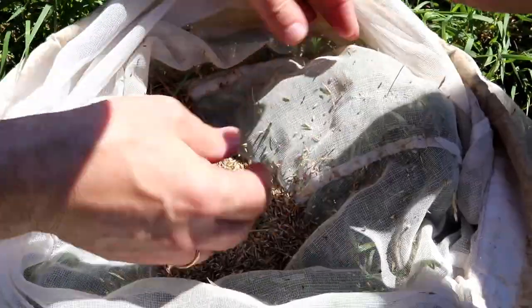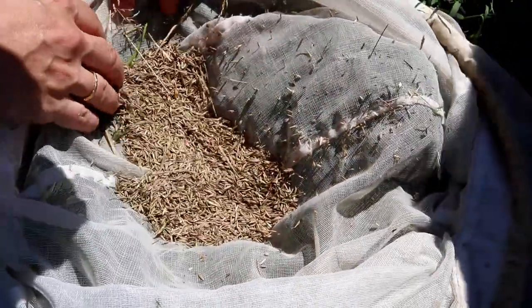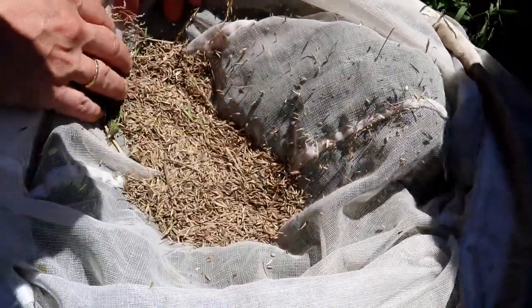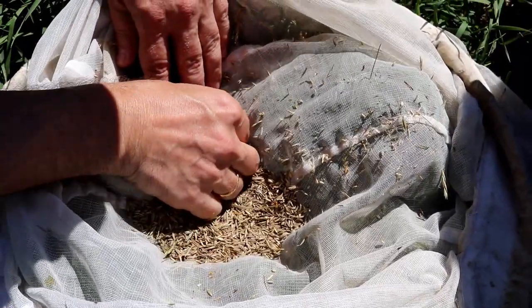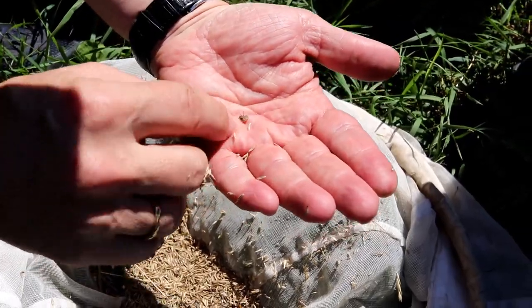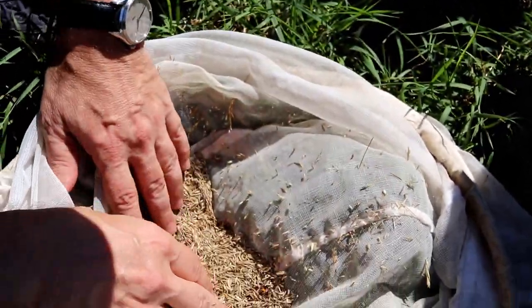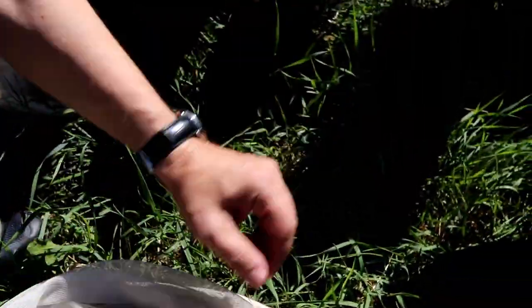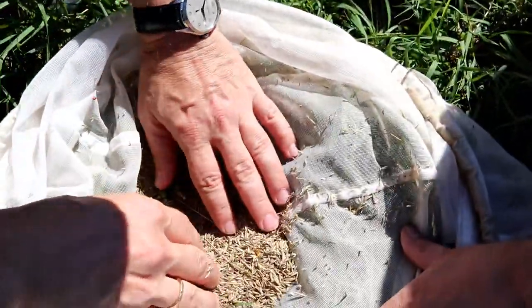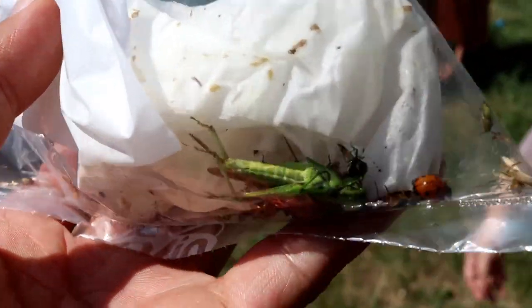Here you see an entomologist — he is an insect specialist. We employed him for the afternoon because he has really very good knowledge of biodiversity. He is able to sort through the insects right now and releases those that are not going to be identified, so we want to minimize the number of insect deaths.